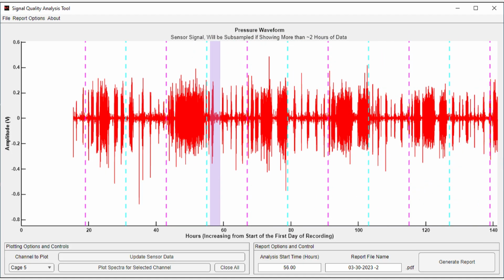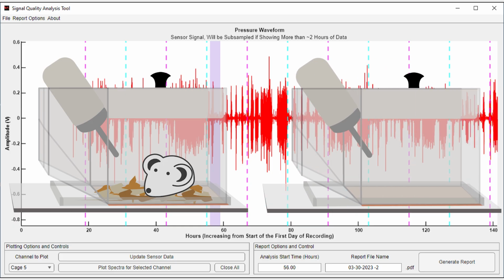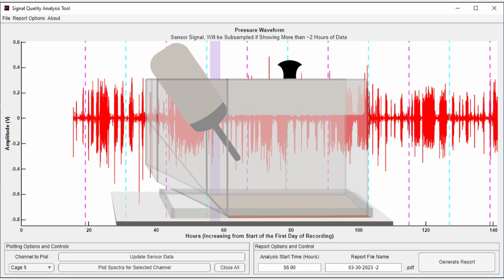When testing a system SNR, all cages can be occupied, or some cages can be left empty to directly observe the interference patterns and power levels. The signal patterns observed in an empty cage are referred to as the noise floor.